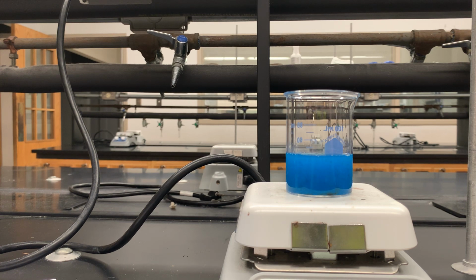We're going to continue watching this. And as long as this is stirring, then that's a good thing, and this reaction is going to take place. Oh, you can kind of see I'm going a little too fast because my stir bar has gone a little bit haywire, and it's just spinning around too much. But it's still kind of controlled chaos there, I guess.